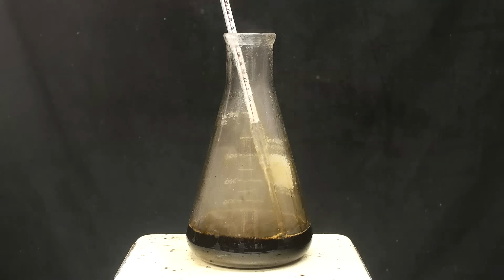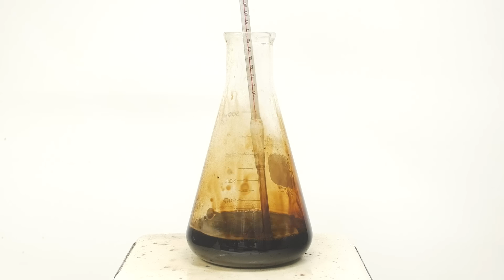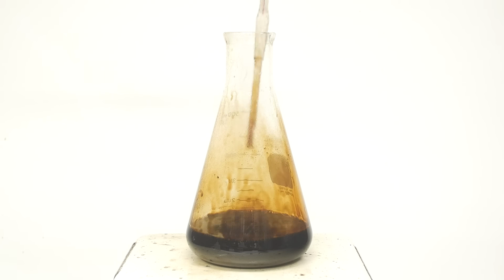The solution is giving off a lot of white vapor, and at first I thought it was water, but I think it's something much worse than that. I don't really have a way to completely confirm this, but I think it's a combination of smoking fatty acids as well as acrolein from the breakdown of glycerol. So not only is it irritating to both the lungs and the eyes, but the smoking fatty acids are technically a fire hazard. Anyway, 100 minutes later, the reaction should be done.